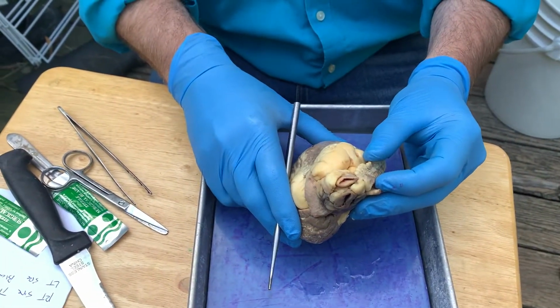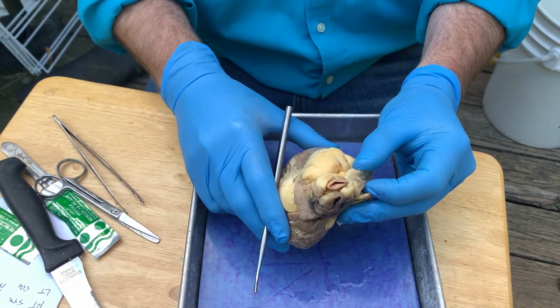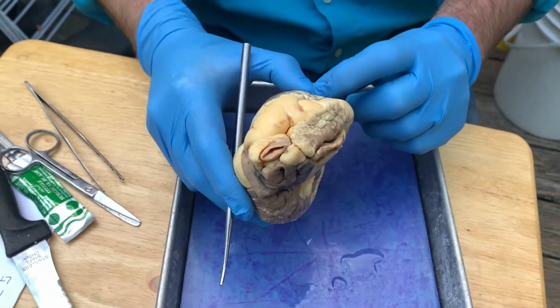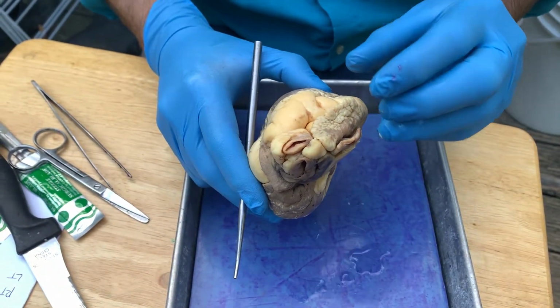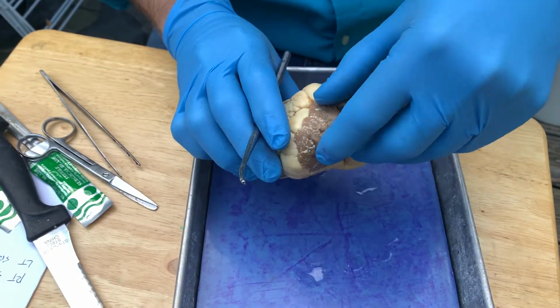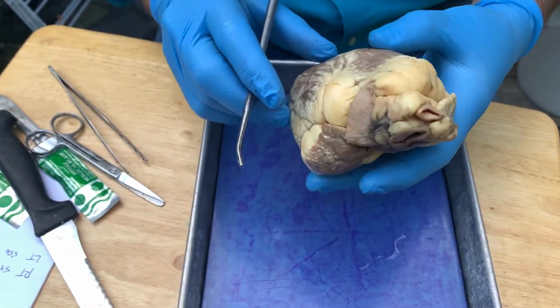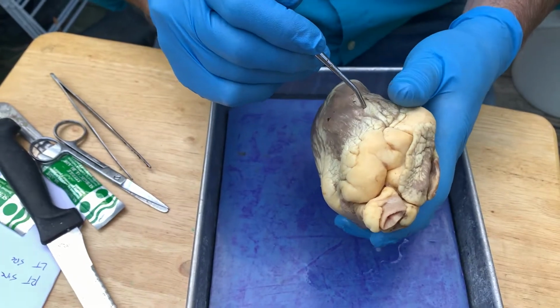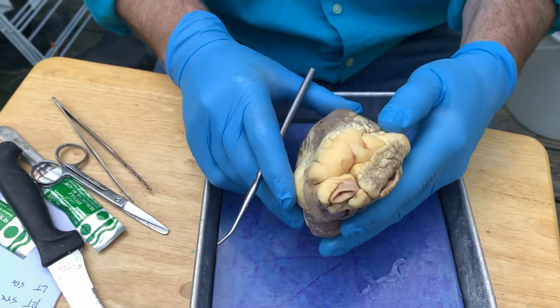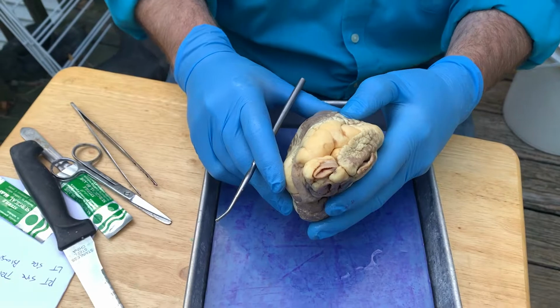The auricles are on top of the atria, and they increase the surface area. As you're probably aware, the atria, where blood comes into, is significantly smaller than the ventricles. So in order to accommodate all of the blood, these little auricles, sometimes called the dog ears, will expand to accommodate that blood. Here, this is the left descending coronary artery, okay? This is also known as the widowmaker. People who have a blockage in that artery often don't survive their heart attack.